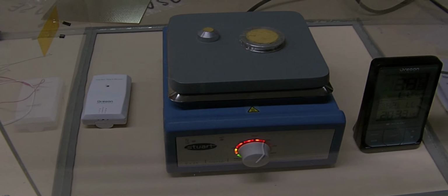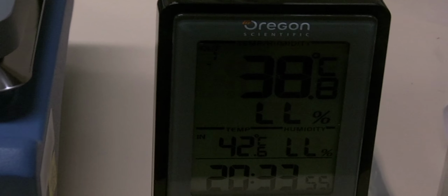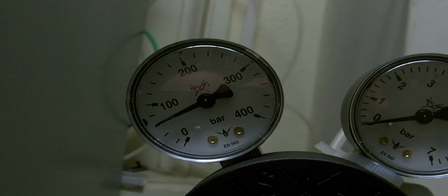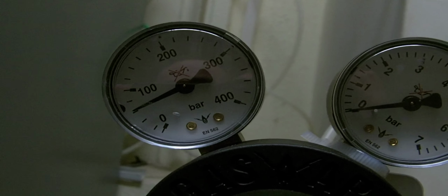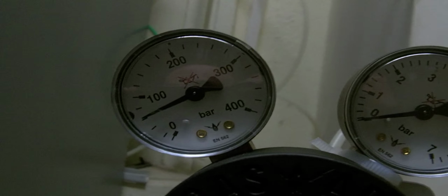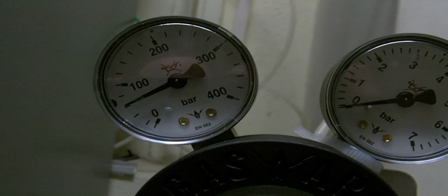The samples have been in for just over half an hour now, and as you can see, the temperature inside has risen from an initial 20 or so degrees to 38 degrees on the left-hand side and 42 degrees on the right-hand side. After about a day, the pressure on the nitrogen cylinder has lowered to about 60 atmospheres, or 60 bars. Now, we'll know that the cylinder is empty when it gets down to about 10 bars, so hopefully this one cylinder should last for the full 3 days to prepare the first sample in the desiccator.